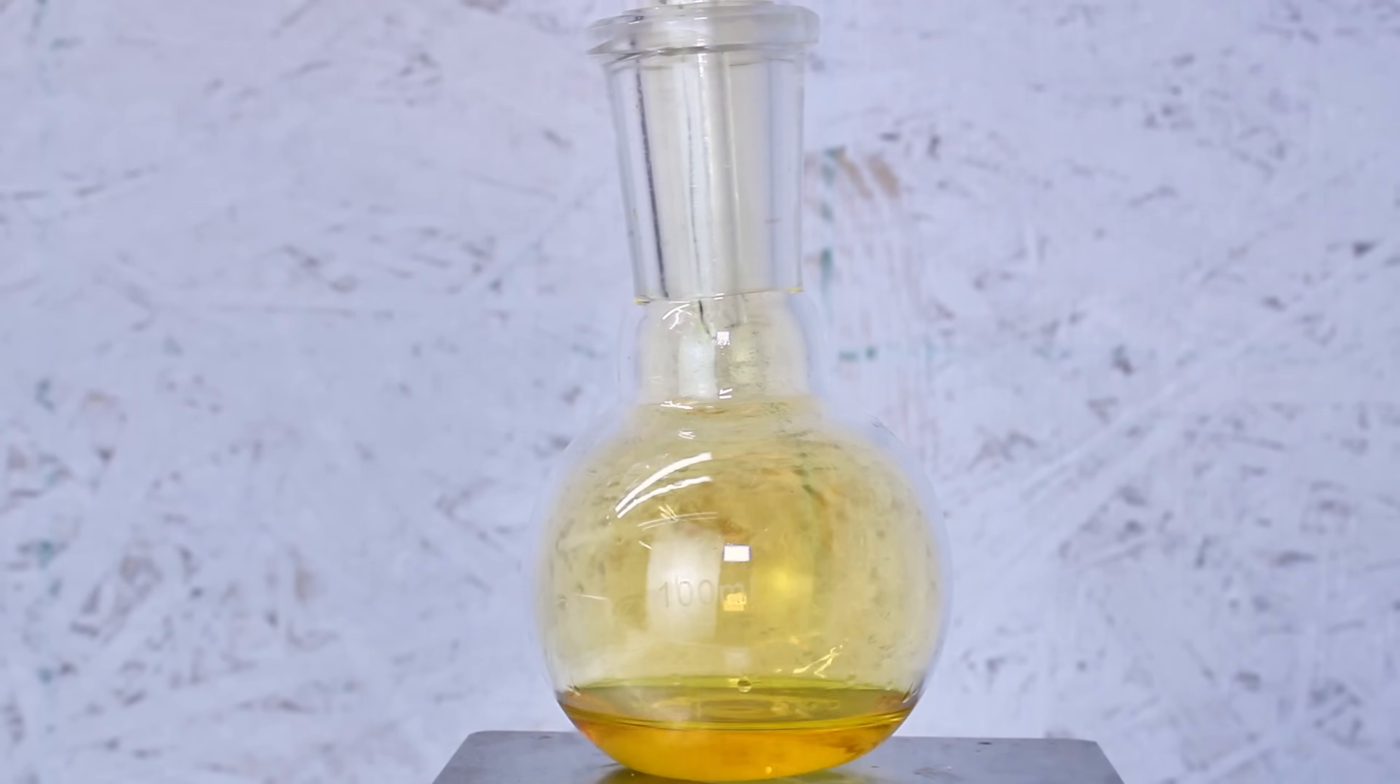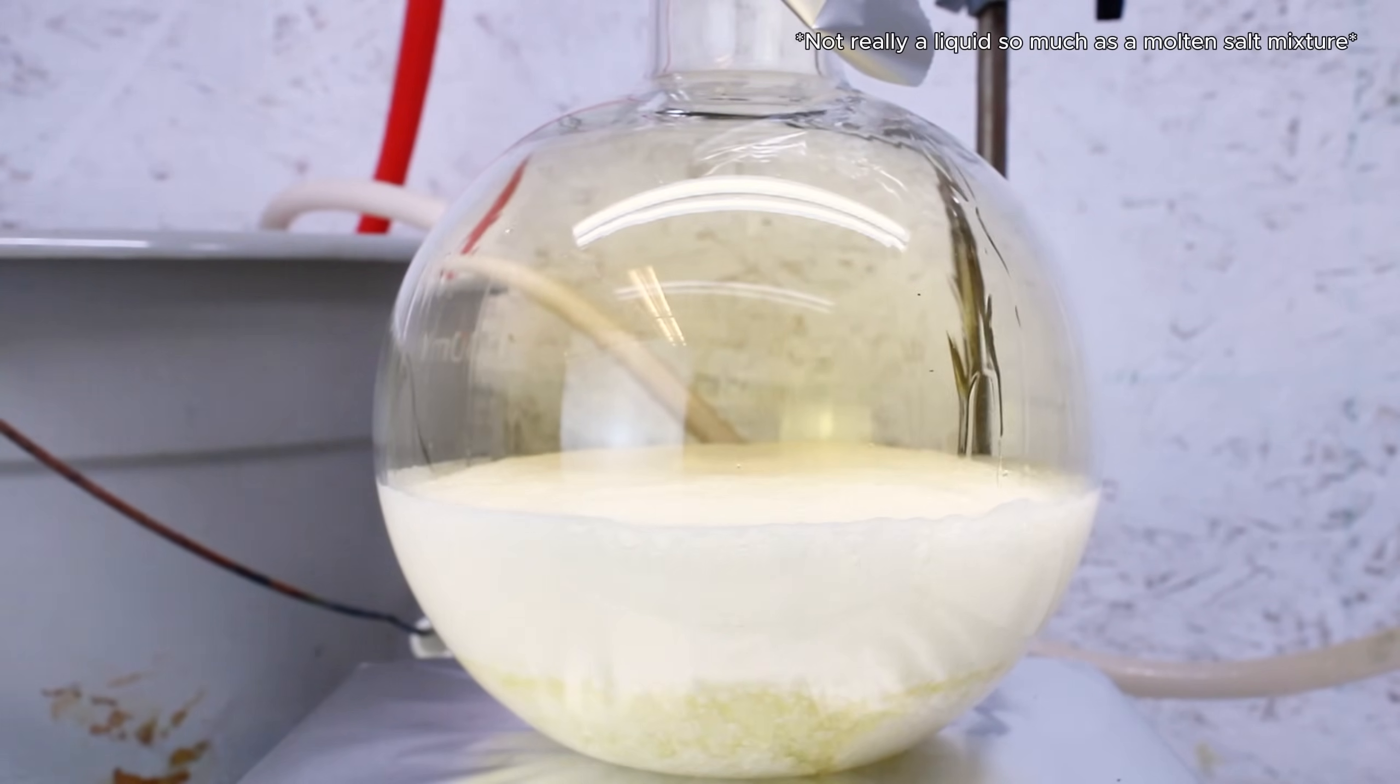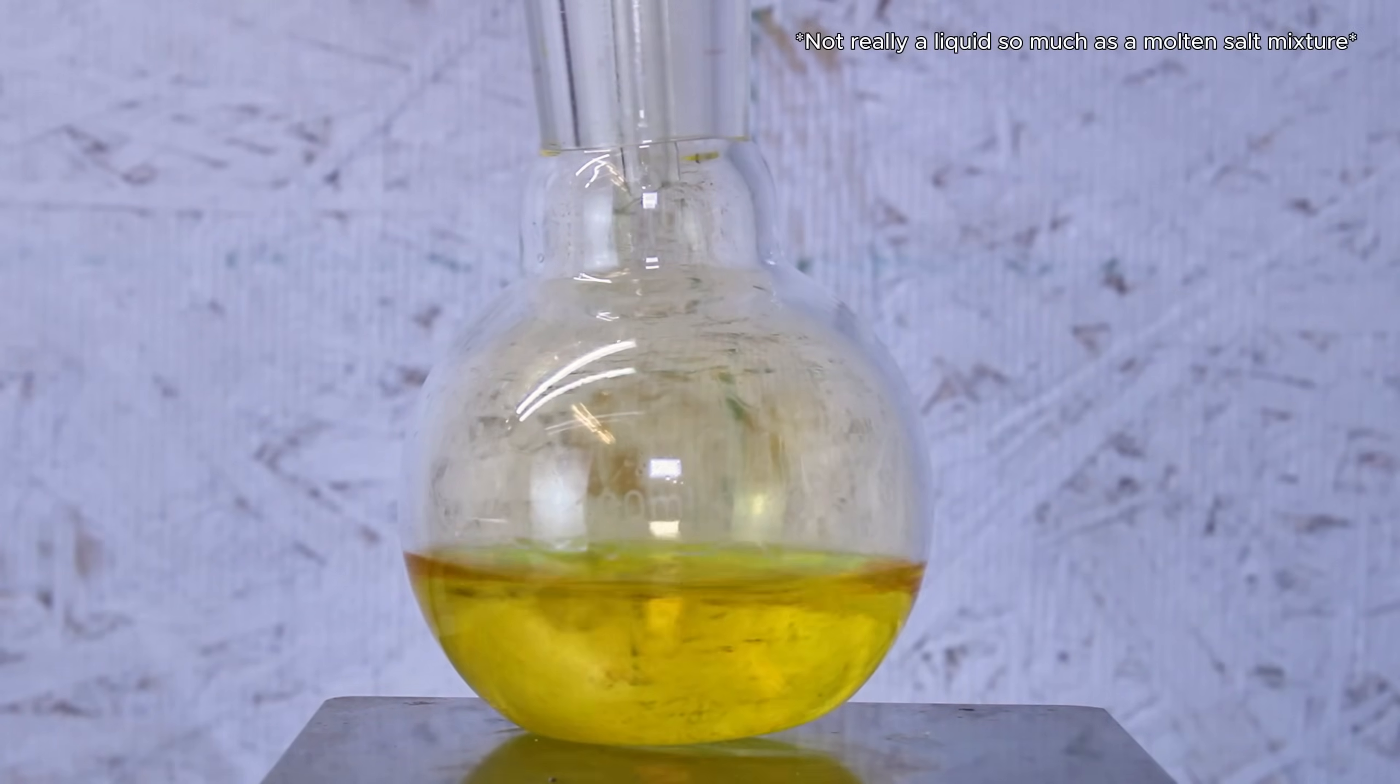Meanwhile, my typical method of using equal-part sodium nitrate and sulfuric acid is a lot easier to handle, as even once all the sodium nitrate has been used up, the mixture will remain a liquid. Also, sodium bisulfate is a useful reagent in many other reactions, so I like to recover as much as I can.